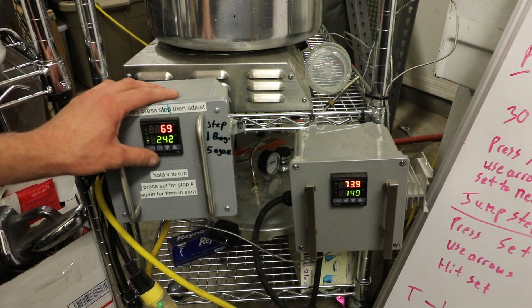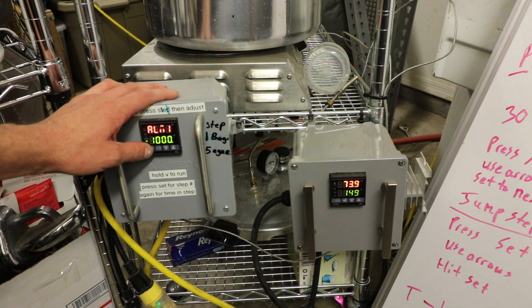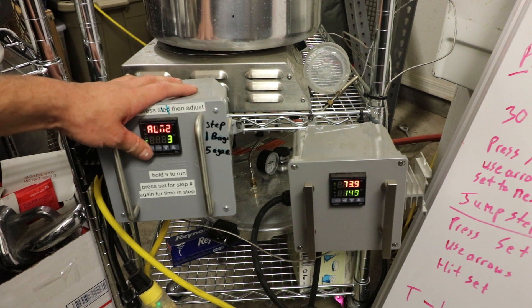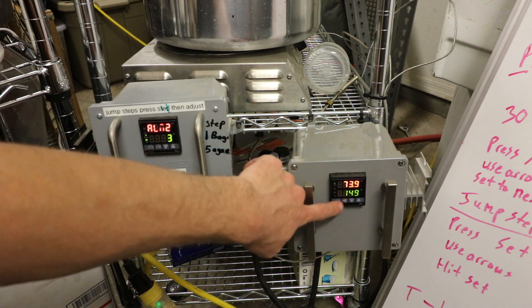Once again, we're going to go in there, hold the step on it. Anytime you don't press the button, and now I'm into the programs, I hit it too long. Anytime you don't touch a button for 10 seconds, it goes back to the home setting.